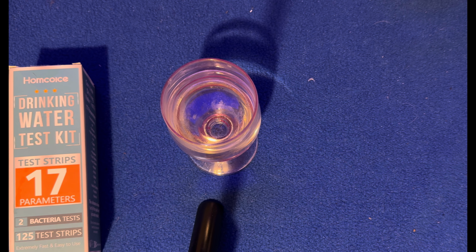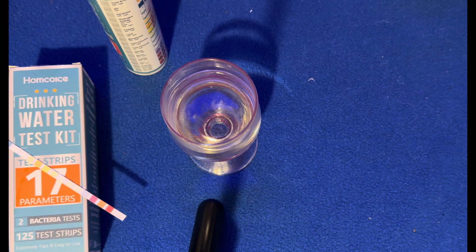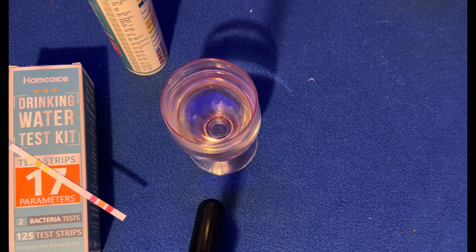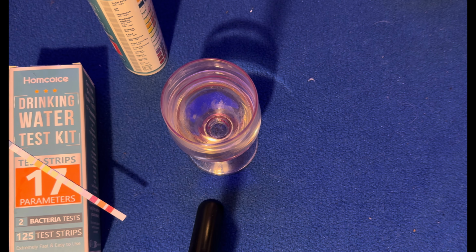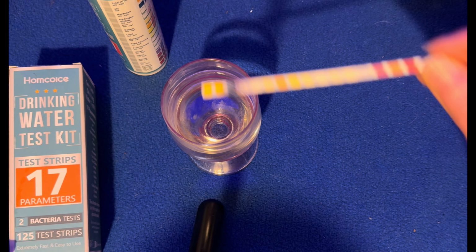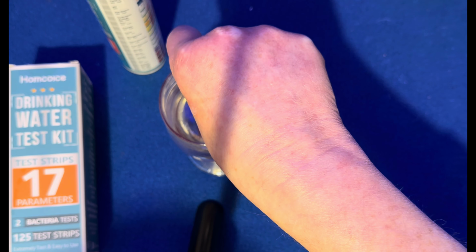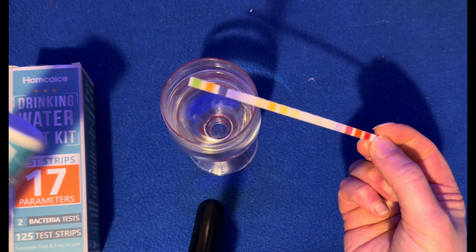I'll just pop another test strip out. Okay, let's close that off. I am cheating actually, because I've got a picture of the bottle next to me, because the writing is really small on the test strips and I can't read it very well at this distance from the camera. So, okay, this is the stream water. So we're just going to dip it in there, make sure all the surfaces are covered. 1 second, 2 seconds. Get the excess moisture off and then try and keep it as flat as I can.